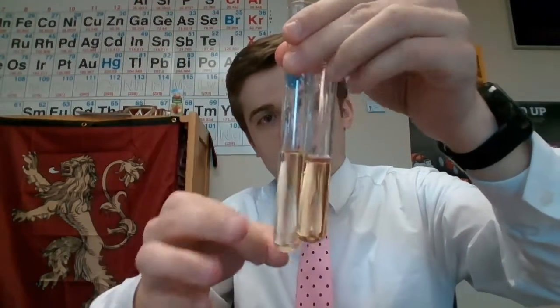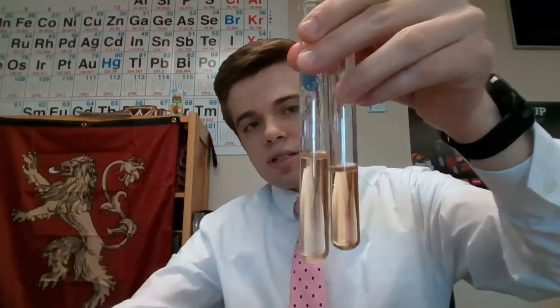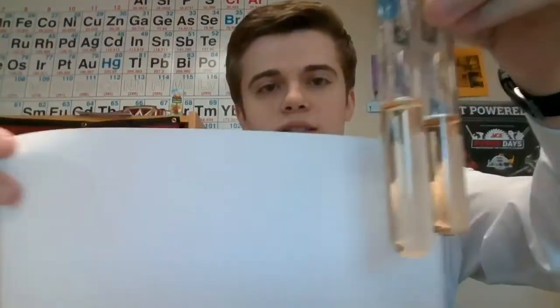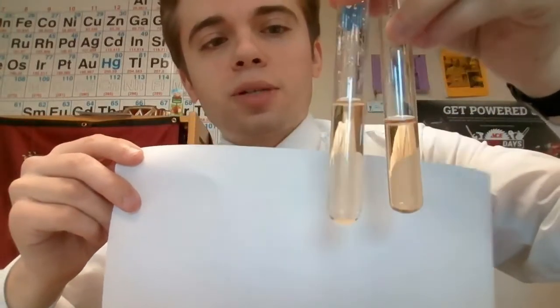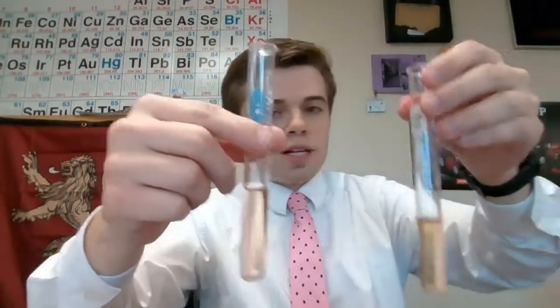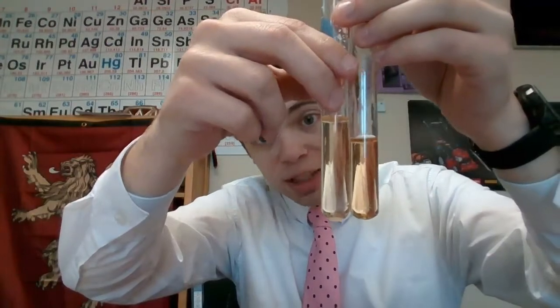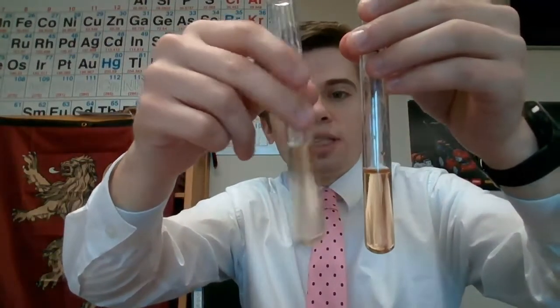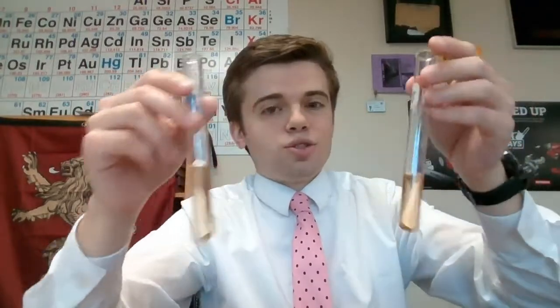And I want you to see if you can tell me what happened here. Let me see if I can put a white background on this so that you can see it a little better. But can you tell me what way equilibrium shifts? So this one over here is one that we added our solid potassium chloride to, and this is our control. So what do we see? It's a little bit lighter. It's kind of hard to tell, but it is a little bit lighter. I want you to say what way did equilibrium shift whenever I added this to our solution?